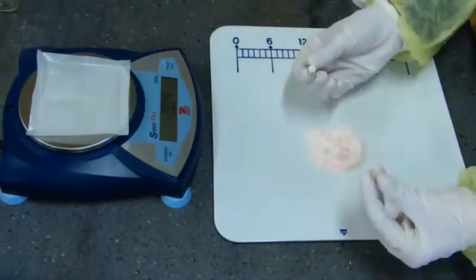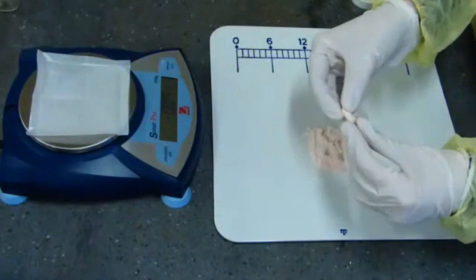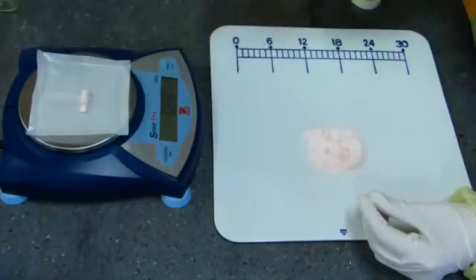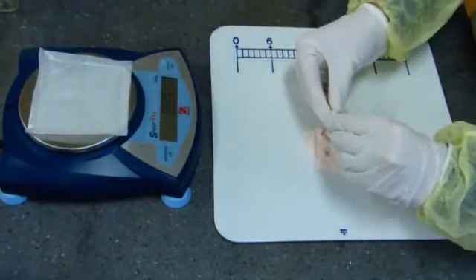Before weighing the capsule, the head should be placed gently over the body to prevent spilling the powder onto the balance. Do not lock the capsule until the proper weight has been achieved. Then place the punched capsule on the electronic balance to determine the weight of the powder inside.